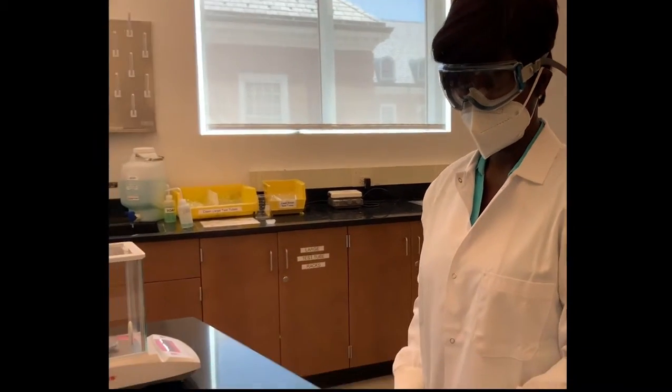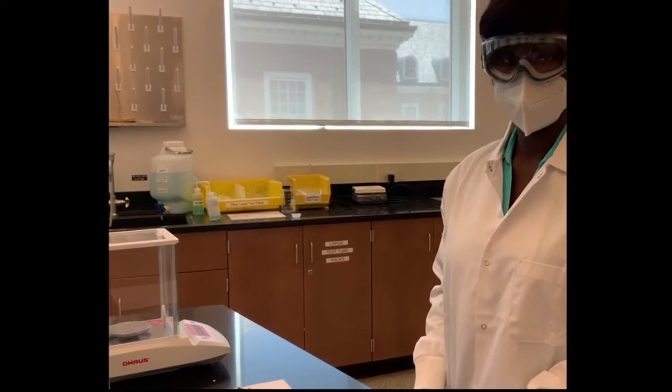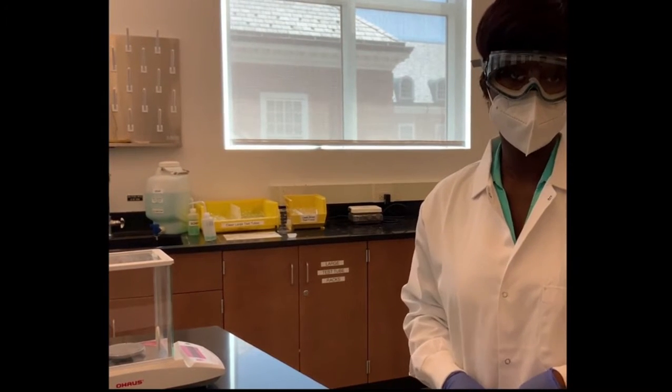In this video, I'm going to show you how to determine the density of an unknown metal by measuring its mass and volume.